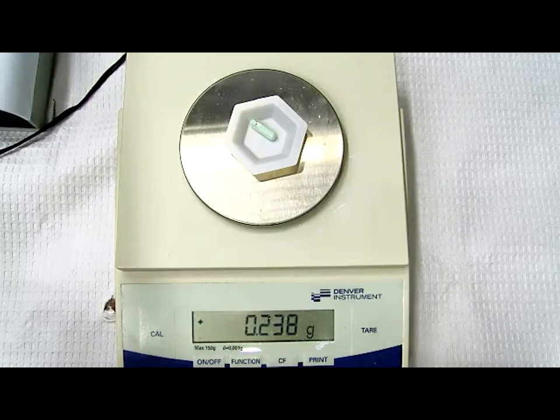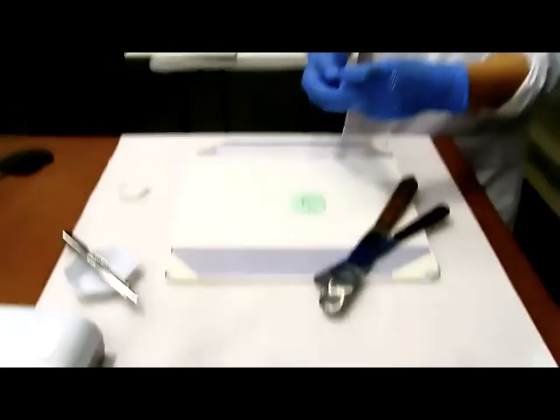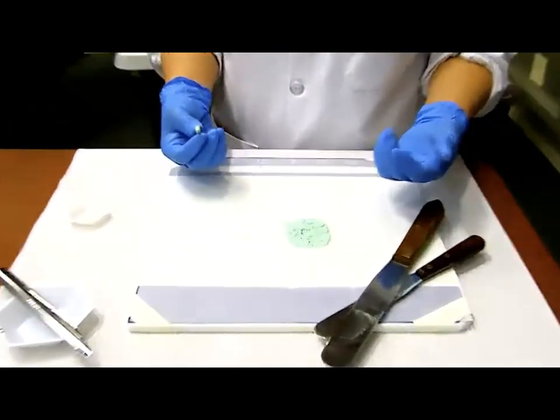So 237 to 263. Some of you are looking at that and saying, okay, that's a keeper, it's good. But see, it just moved a little bit. That's maybe a little bit low, especially on a test. You're going to want to be closer to the 250. So I am going to do a little modification of the weight. What should I do then? It's too light. I'm going to do a couple more punches of the powder.